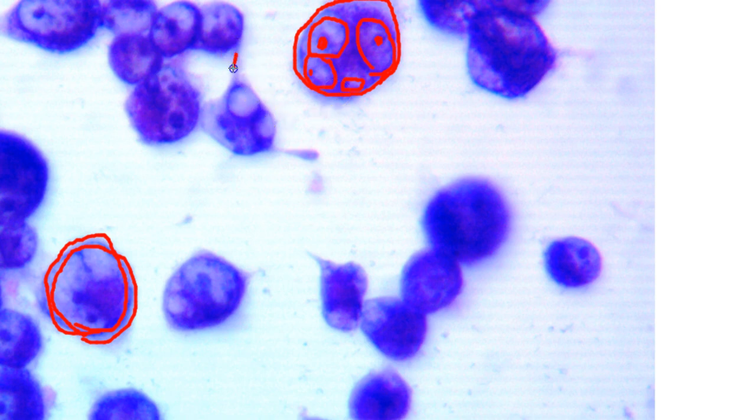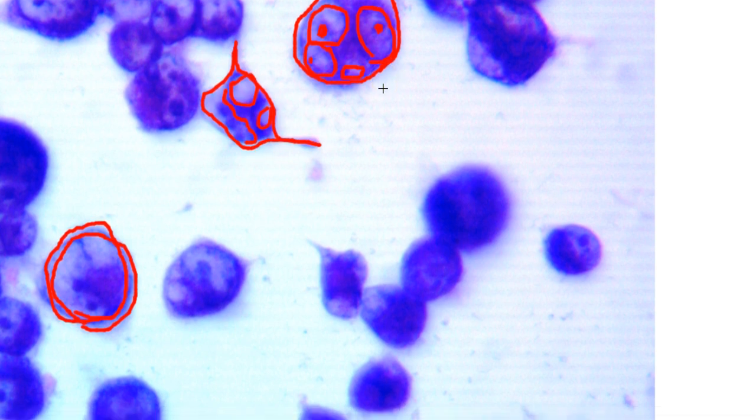This cell is actually undergoing cell death eventually. You can see the vacuoles forming in there that look like holes. You can see these are the vacuoles, right? They look like holes in the cell. You see the nuclei are getting disintegrated. They don't even look like real nuclei anymore. And you see the cell membrane, right? Oh, that looks like a monster. That looks like Shrek. Oh well.